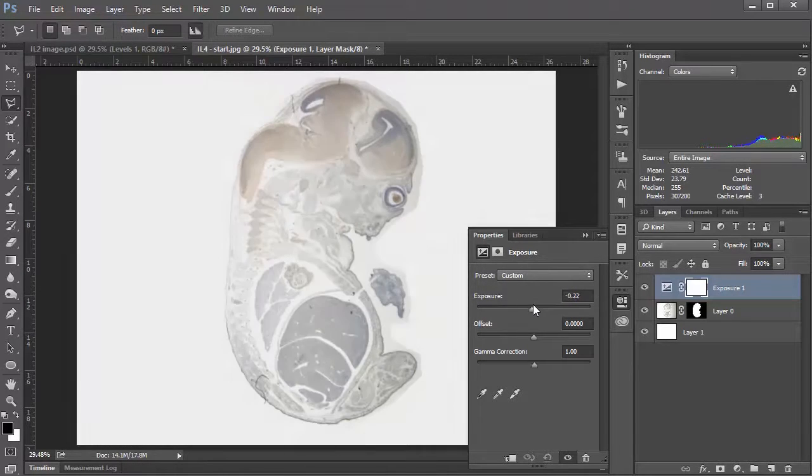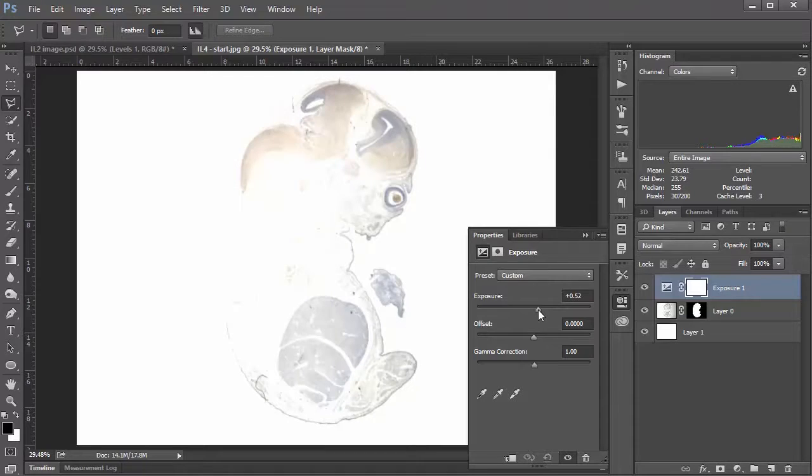Frankly, all I really did here was tinker around with this slider until I found something that I liked. What I'm looking for is to expose this side so we don't have that dark shadowing anymore.